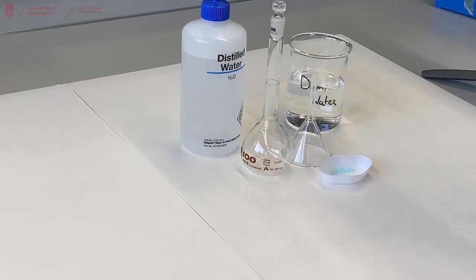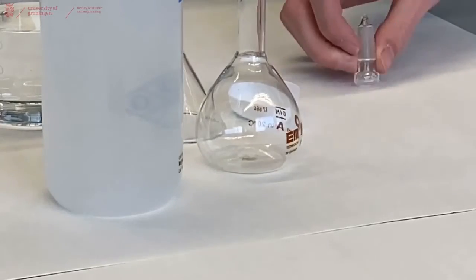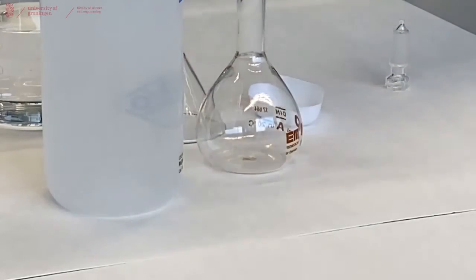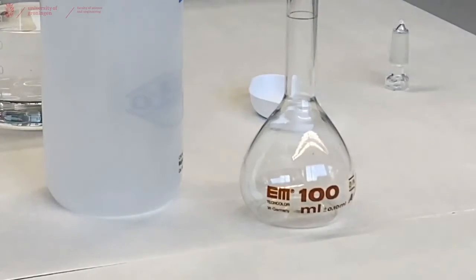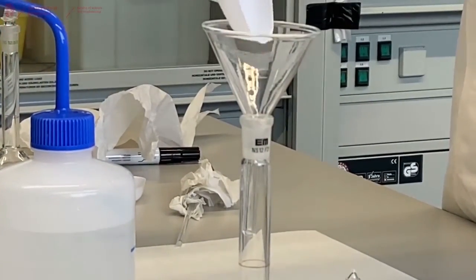To do this, we are now going to carefully put this copper sulfate into the volumetric flask. So we have our volumetric flask, I'm adding a funnel on top, and then you pour in the copper sulfate.